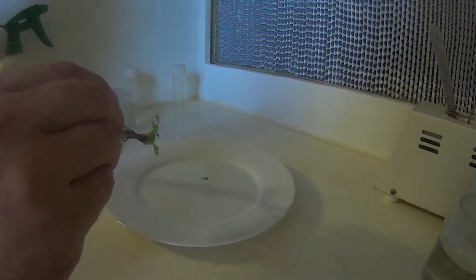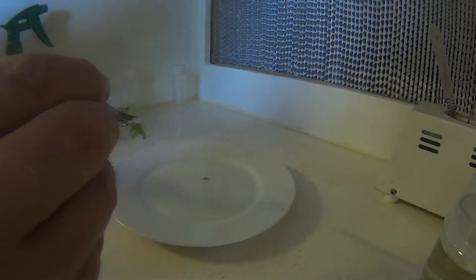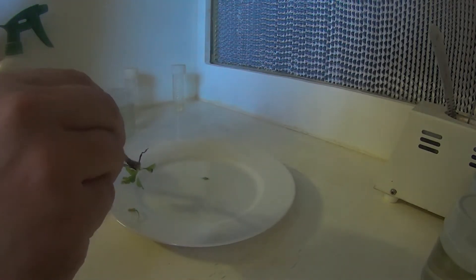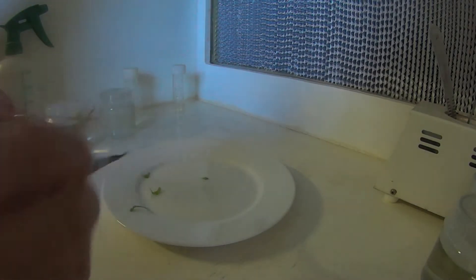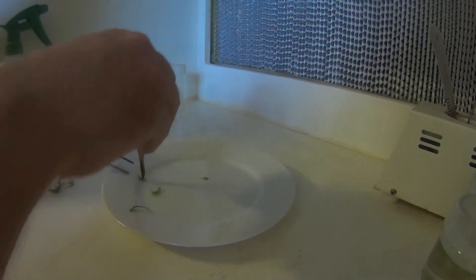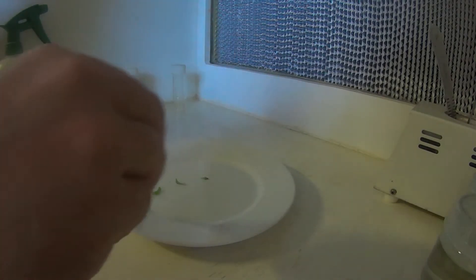Most of this can be used anyway. I just tend to take pieces that haven't actually opened up a trap yet. But for the purpose of the exercise we'll just take a few pieces. That should be enough. Remove the traps off of these two. They tend to die off pretty quickly anyway.